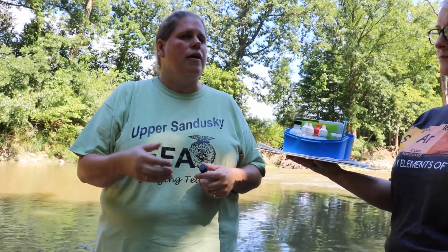The pH test that we did is important because if you have really acid water or really alkaline water, it can affect the reproduction of your organisms and also affect their gills. So the next test we're going to do is the dissolved oxygen test. All of our organisms, the macroinvertebrates that live down in the water, breathe using dissolved oxygen. We're looking for more than 4 or 5 parts per million. Even that low, they're going to have difficulty breathing.